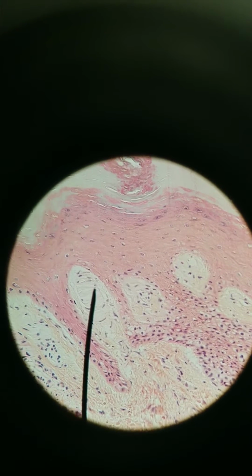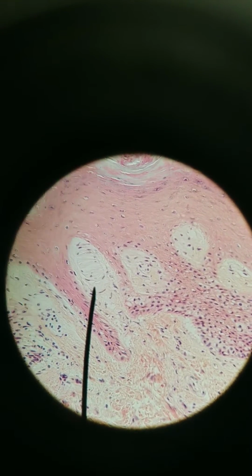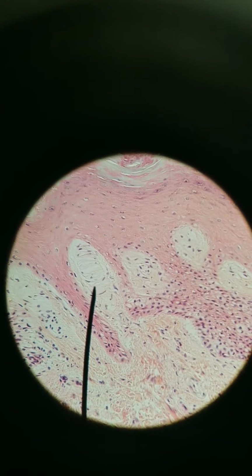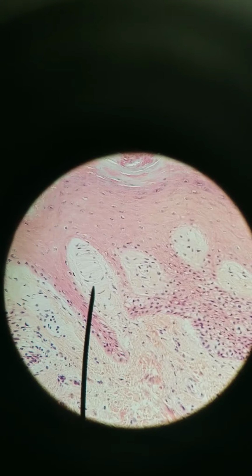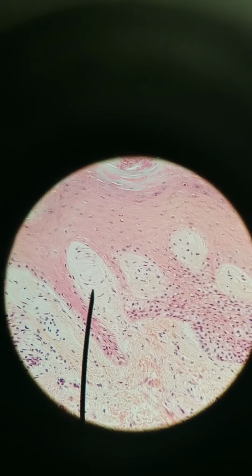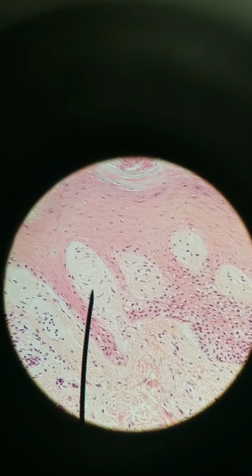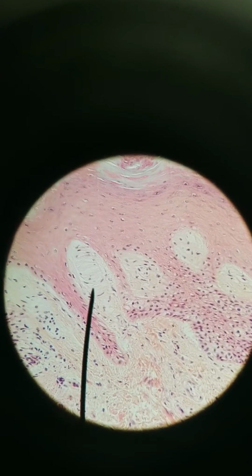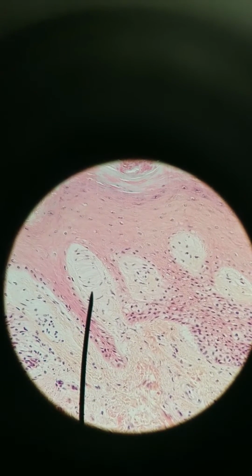It's connective tissue wrapped around dendrites of a sensory neuron. Meissner's corpuscles are also for light touch, light vibration, and that makes sense because, like the Merkel cell, it is superficial. It's one of the more superficial receptors that you find in the skin.